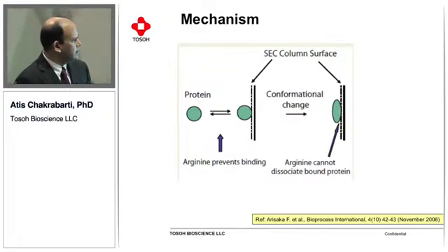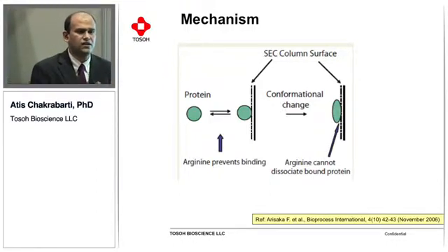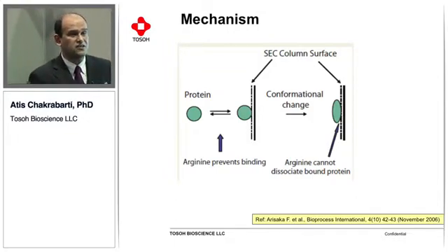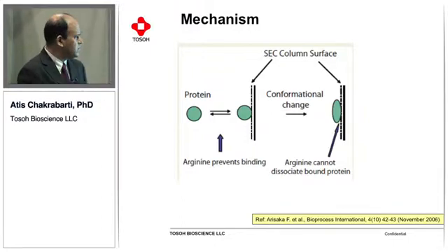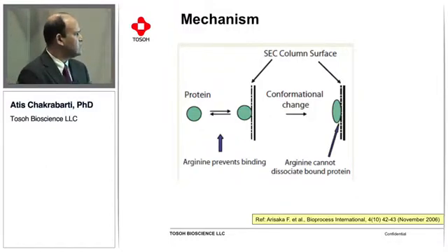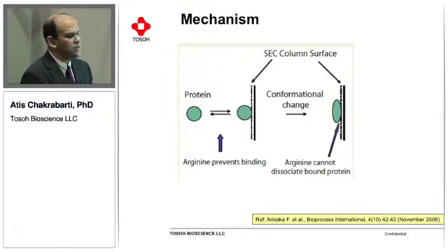There is an article in Bioprocess International which I always request you to read. In it, the TSK gel G3000SW column is used exhaustively to study this type of secondary interaction issue. I am not going into the details, but this cartoon shows what happens. A globular protein, which is spherical in nature, comes into contact with the silica surface. When it comes into contact, if the secondary interaction is very high, then it undergoes a conformational change.